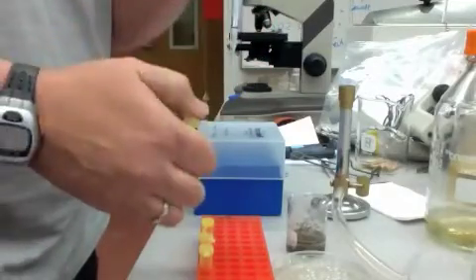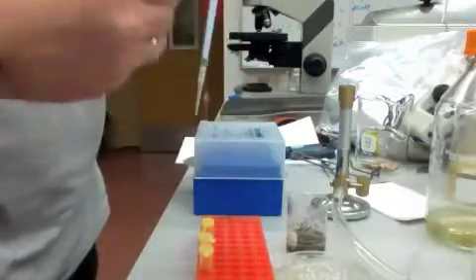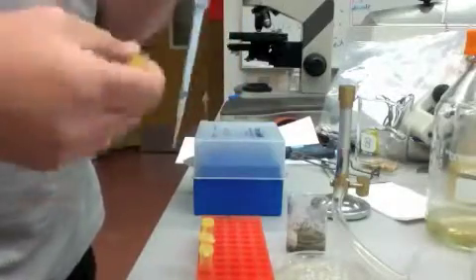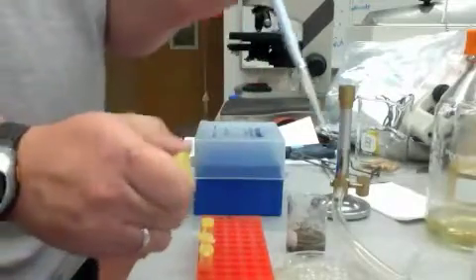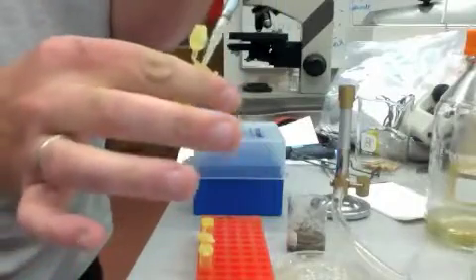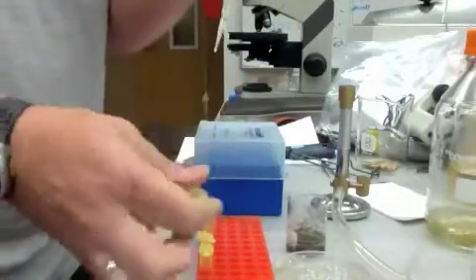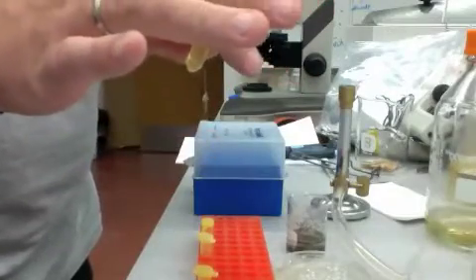I pipette up and down a few times to make sure it's there. You can vortex this or I just shake it back and forth a few times. Get a new tip. And now take a volume and make a 1 to 10 dilution of your 1 to 10 dilution. And do the next in the series. That makes this a 1 to 100 dilution.